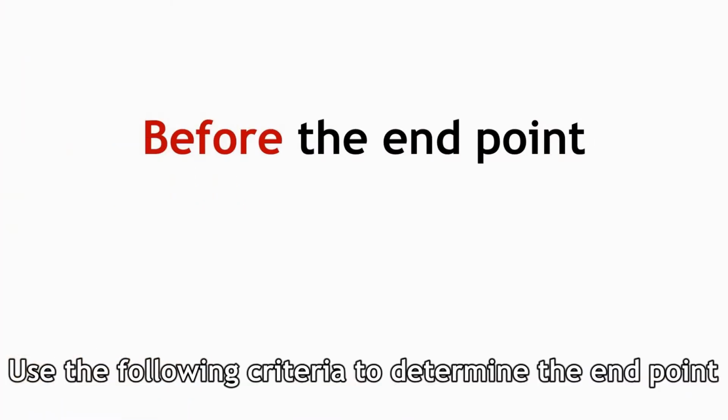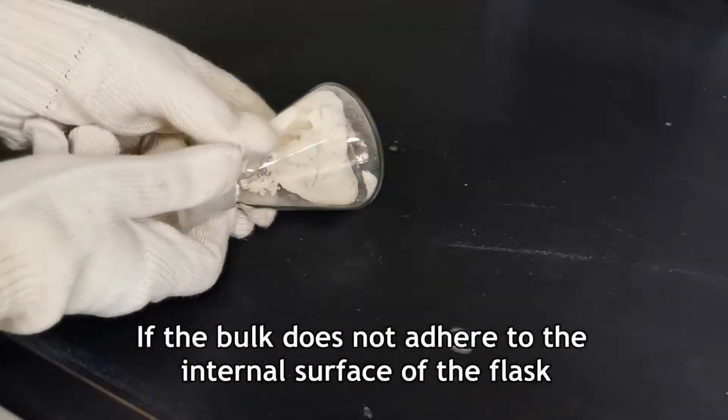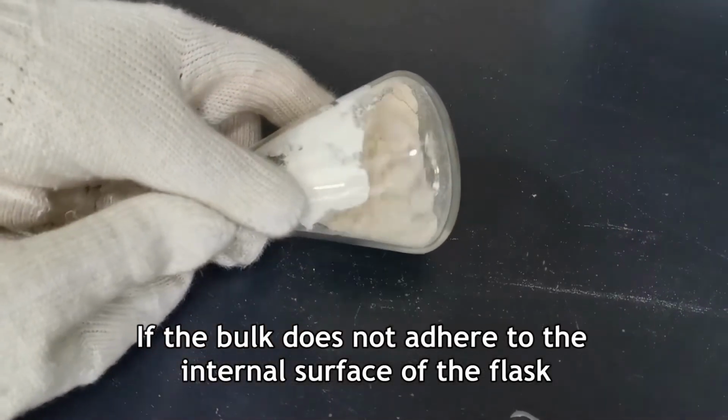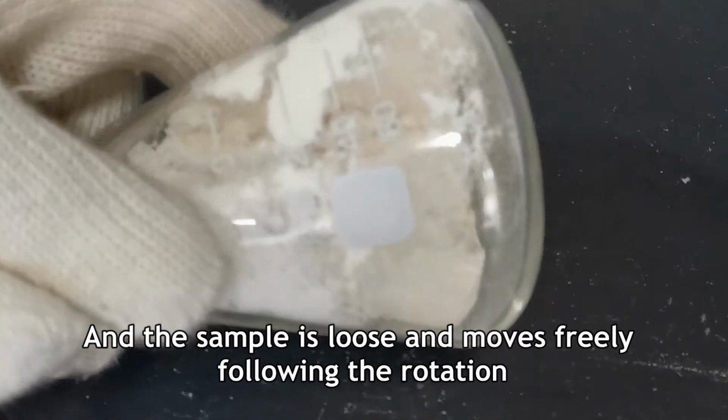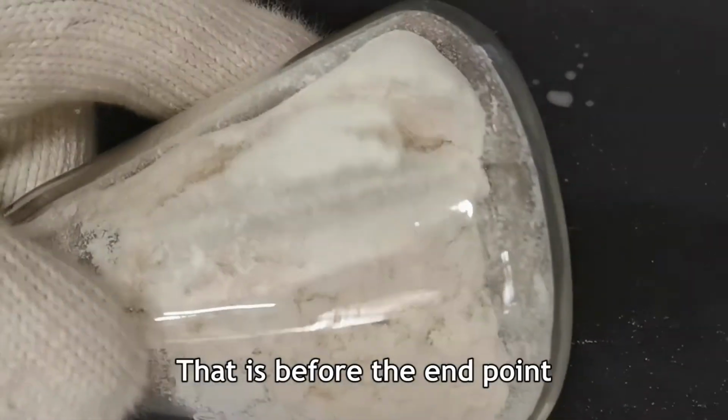Use the following criteria to determine the end point. If the bulk does not adhere to the internal surface of the flask, and the sample is loose and moves freely following the rotation, that is before the end point.